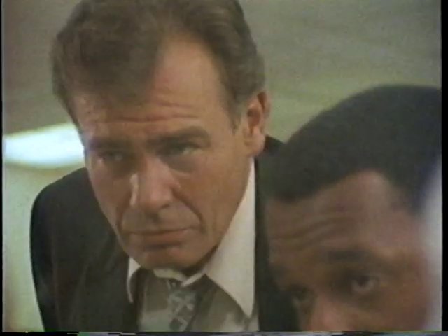If this were a kid, he'd probably be blind. This one, maybe some minor facial burns, but nothing compared to losing your sight. This guy seemed to have his acids and bases covered, so I decided to interview a few of his students.